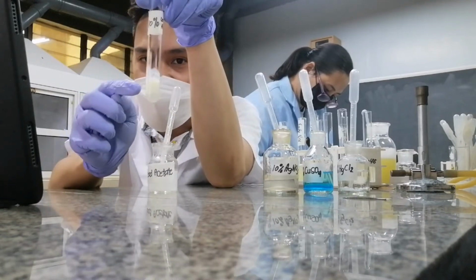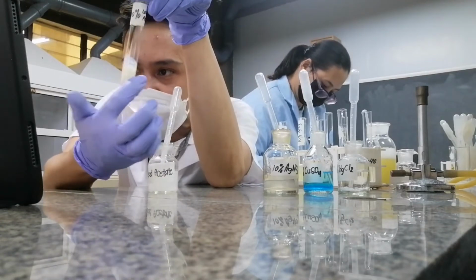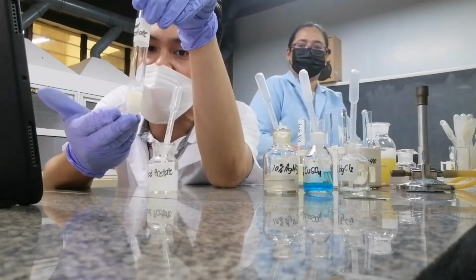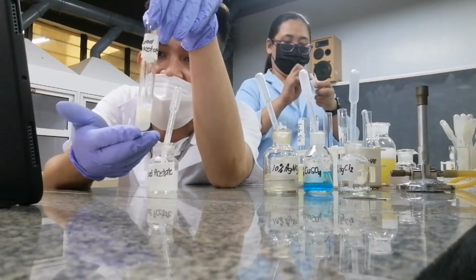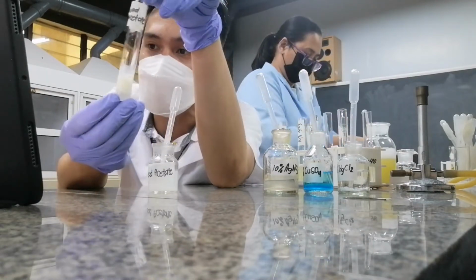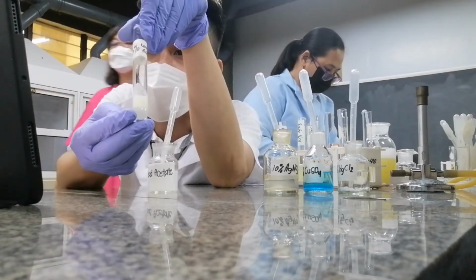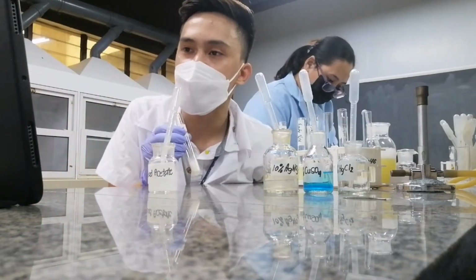In this case, the solid separated, which indicates that the solid produced here is basically a precipitate. So how do you characterize the color of the precipitate produced by adding lead acetate? Lance already said, this is basically a white precipitate. So lead acetate plus albumin produces white precipitate. Is that clear?